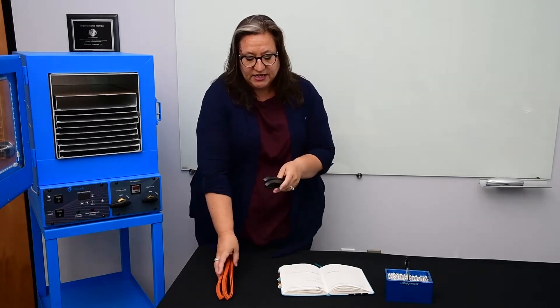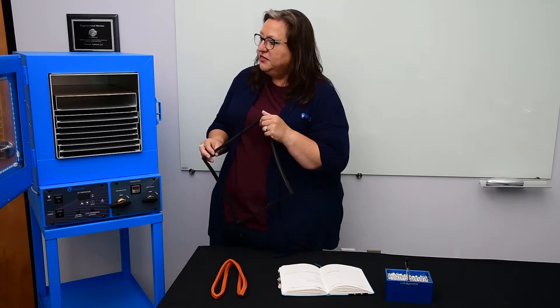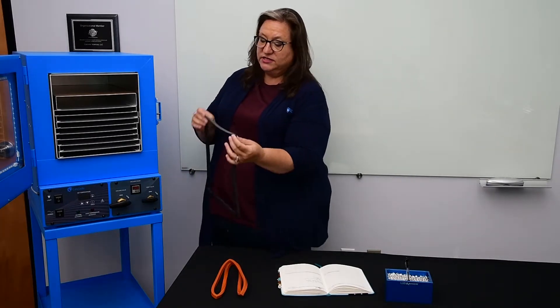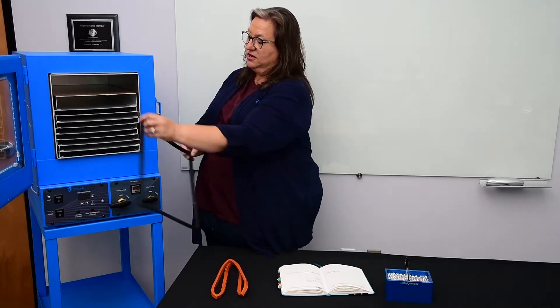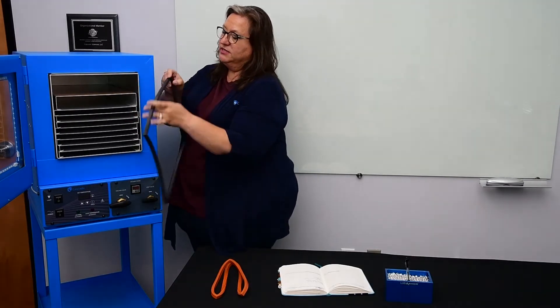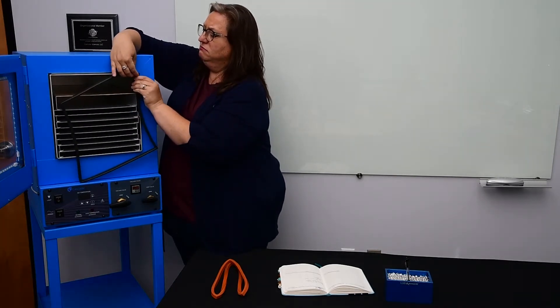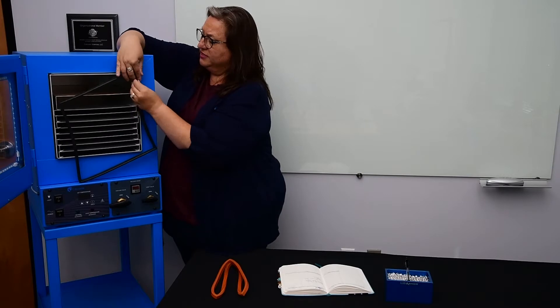For our botanical applications we love this Buna gasket. I know the writing was on this side so I'm just going to rotate that 90 degrees and put this gasket back — super simple to slip on, just goes right over this edge.